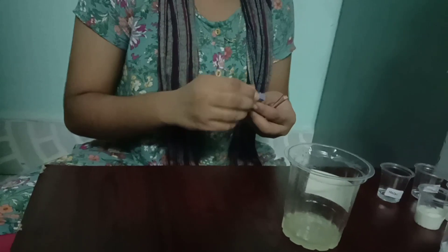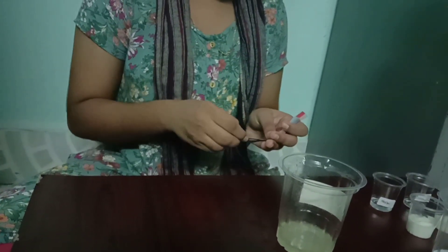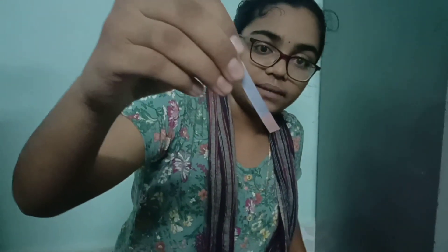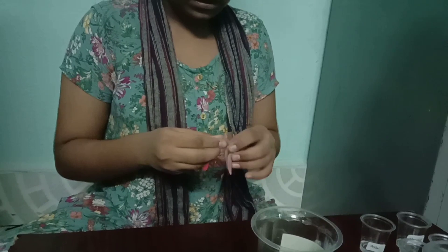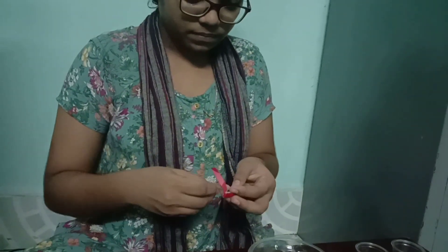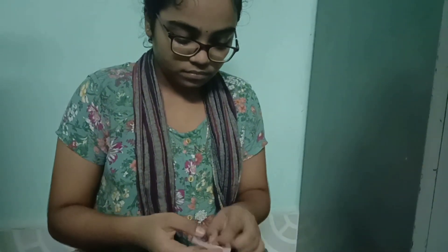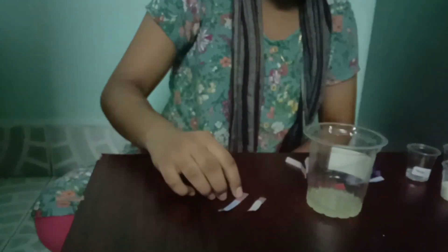Now lemon juice. First I am taking blue litmus paper and keeping it in the solution. You can notice it turns to red. Now I take one red litmus paper and dip it in the solution. You can notice there is no change in the red. So here blue litmus turns to red and red shows no change. So it is an acid.